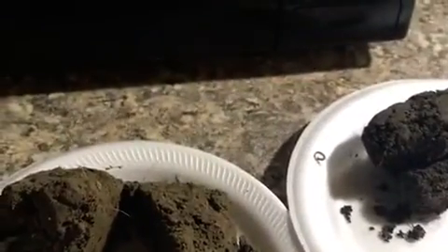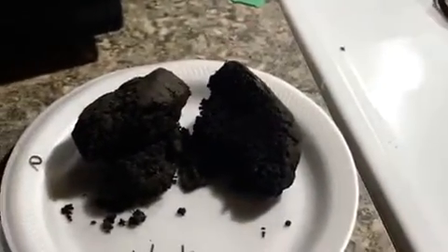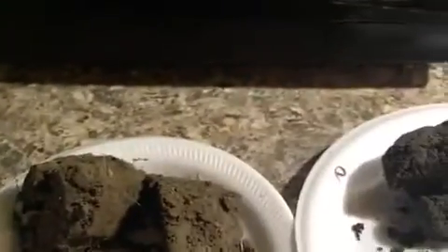So I have soil samples from a tilled field as well as a wooded area that's nearby my grandparents' house. We'll go ahead and get started with the project that's called the Soil Quest.